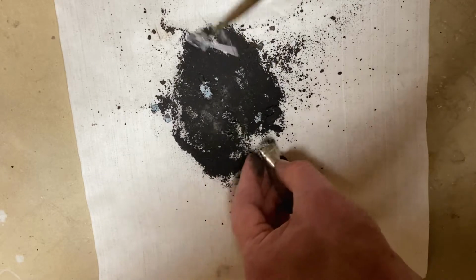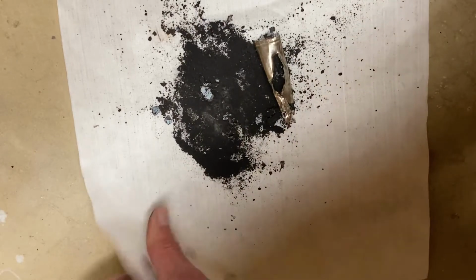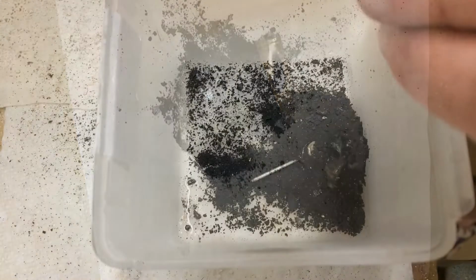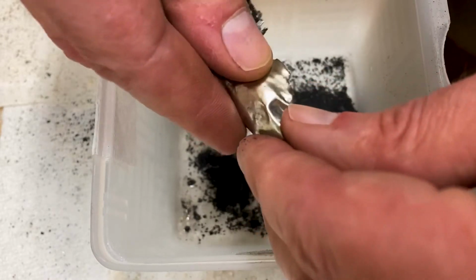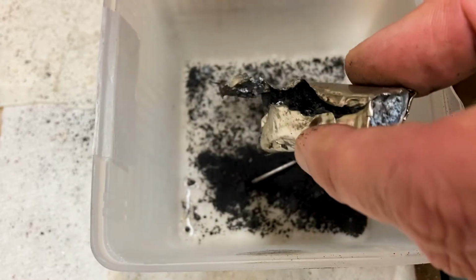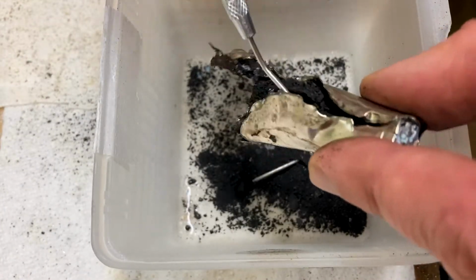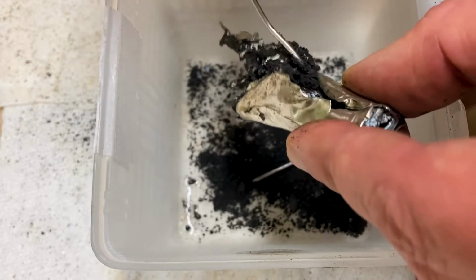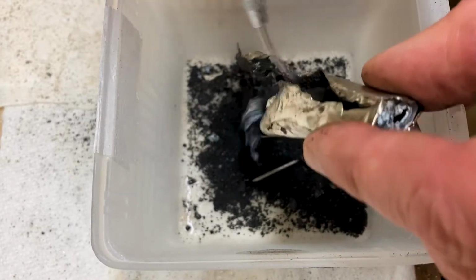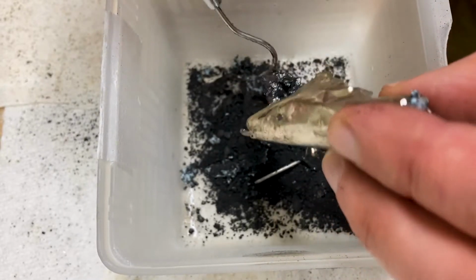Alright, I think I'll do a little bit of off-camera cleaning on this, and also wash my hands and get this thing collected up here. I'll tell you, this battery casing is pretty hot. So what that tells me is that, one, this battery probably was not totally discharged, and the other part of it is that I very much doubt that that was from pounding on it with a hammer, because it's seeming to get hotter. So it was probably just a reaction from the ingredients in the battery, which is why I said I suspect it probably wasn't fully discharged.